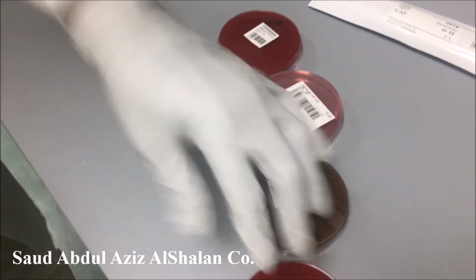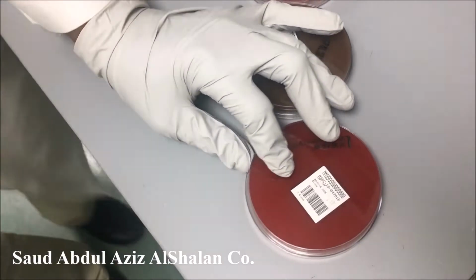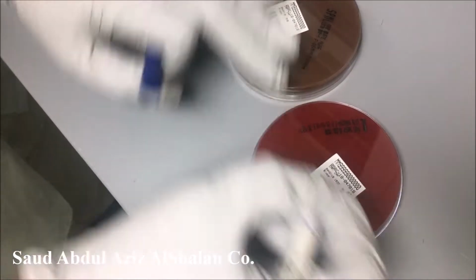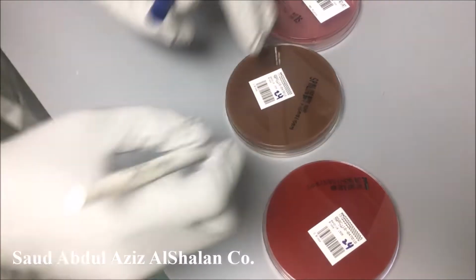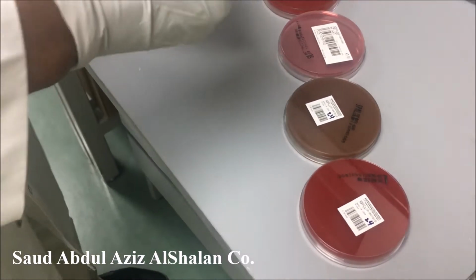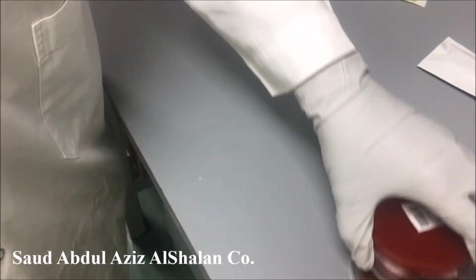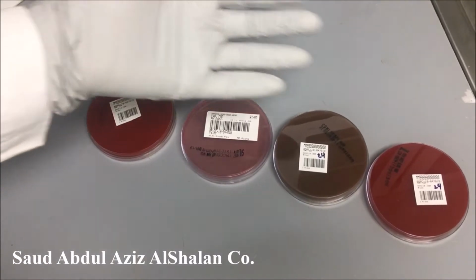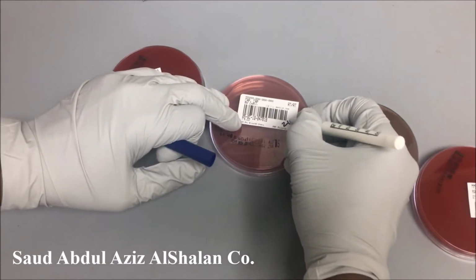And the date should be mentioned because a specimen should not be processed without it. We have to do 2 subsequent subcultures, then we can run our ID and sensitivity for the specimen. Okay, now we labeled our specimen.